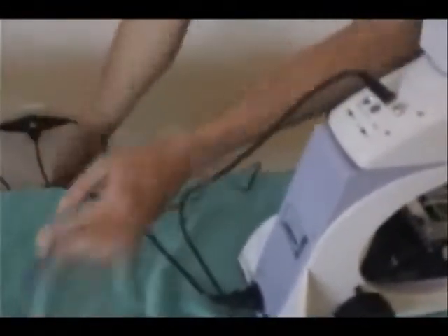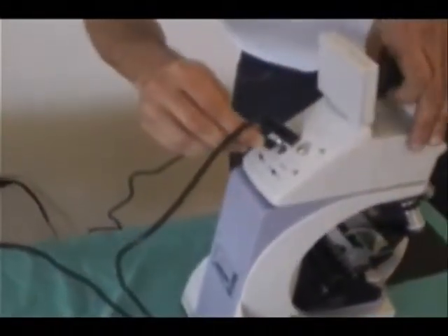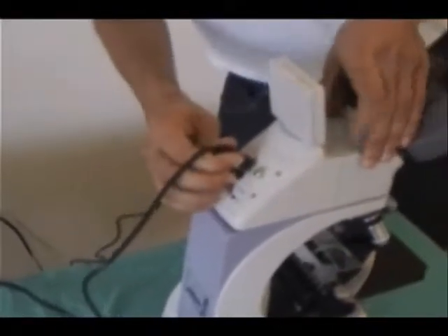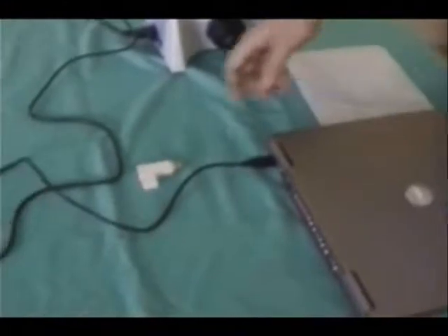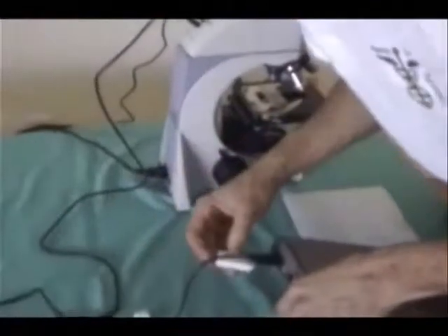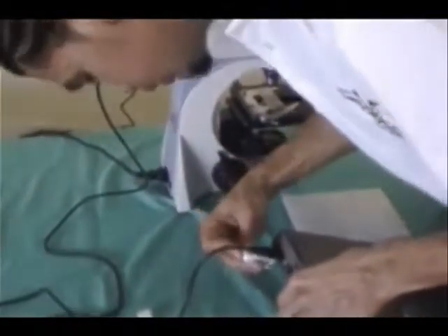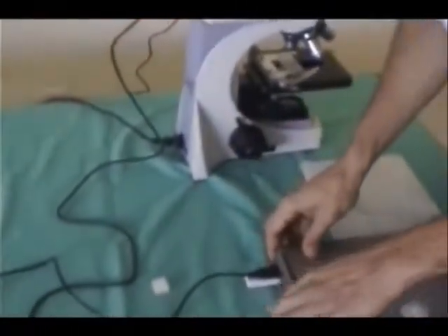Also, you have a power outlet over here. You want to connect that to the back of the microscope so you can have power running to the screen. Now, last but not least, we have a flash drive. This is very important. You must connect this flash drive to your computer if you want to have any functionality with the software. So what you want to do is get that connected and we're ready to begin.